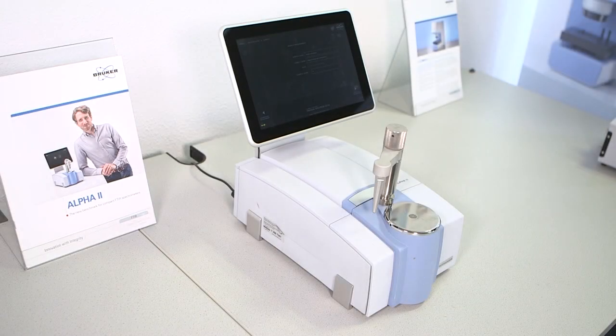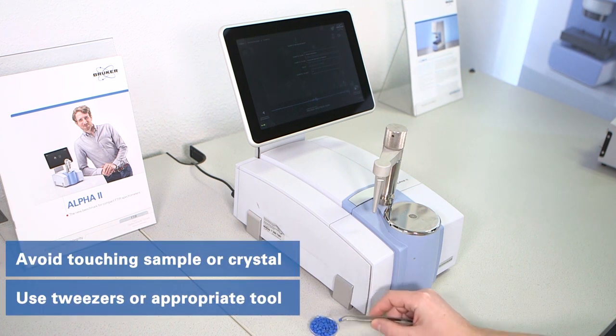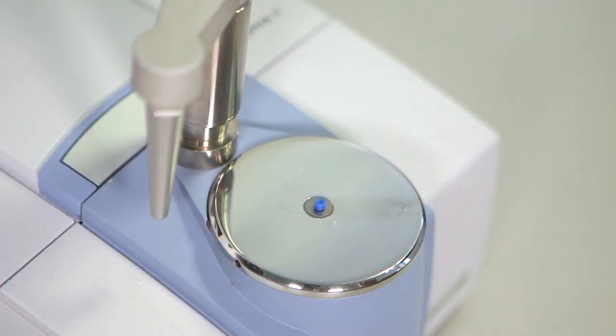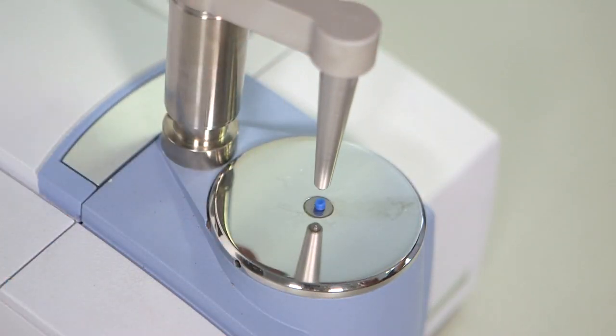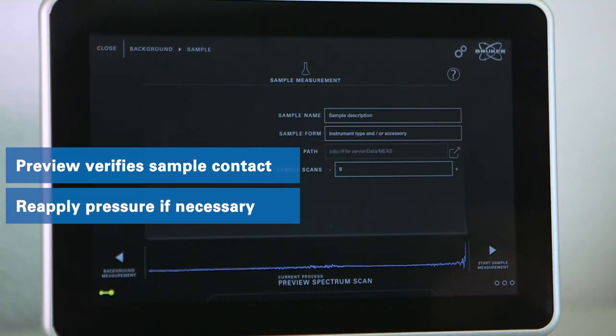To get a clean sample spectrum, avoid touching the crystal or the sample with your bare hands. Use a tweezer or spatula to prepare the sample measurement. Place the sample onto the ATR crystal and apply pressure. Only tight contact between sample and diamond will produce good spectral intensity.